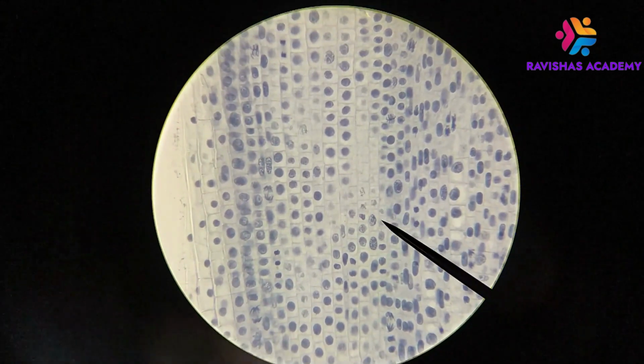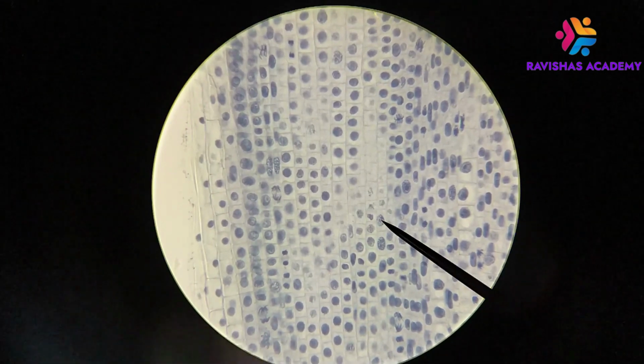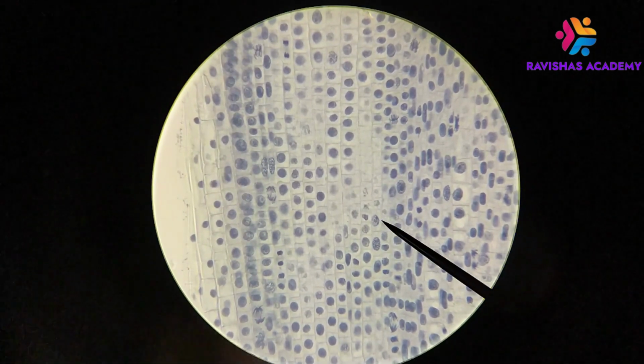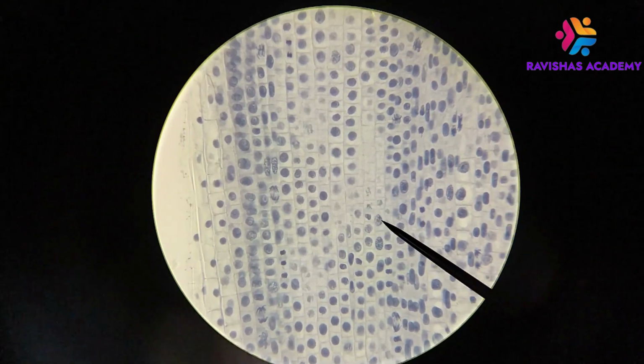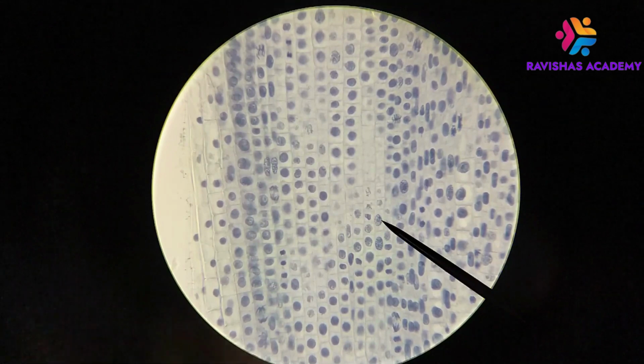And so if we look at this nucleus here, for example, what you will see is that the chromatin here is starting to get a little bit more, I guess lumpy, you could say. It's getting a little bit more granular, so you're starting to see areas that are darker staining and light staining. There's some differences in terms of how things look.